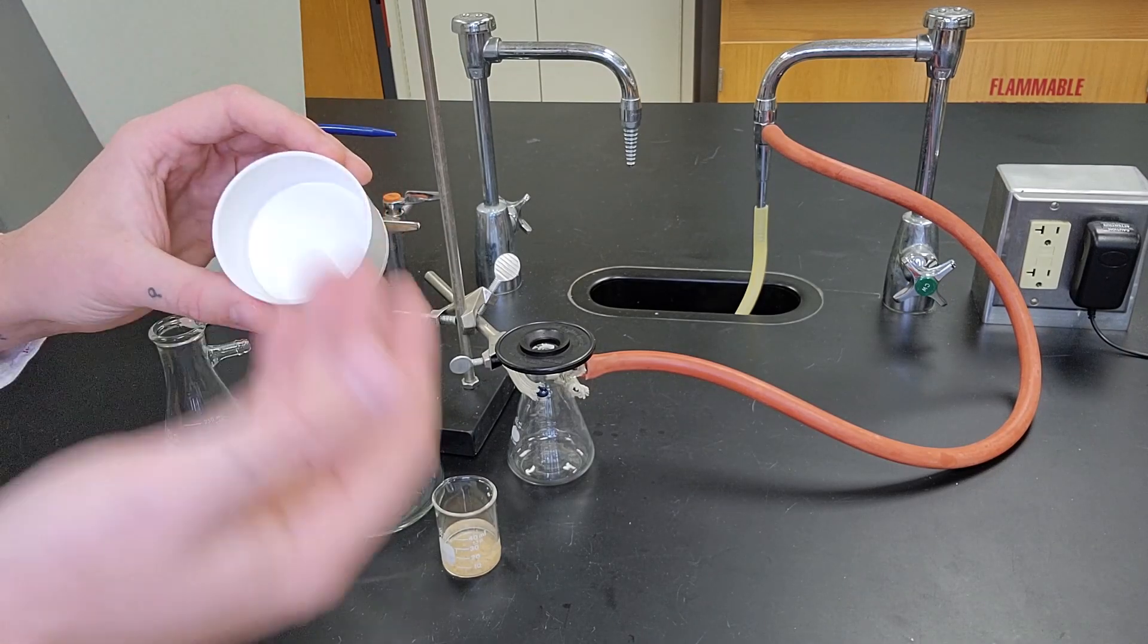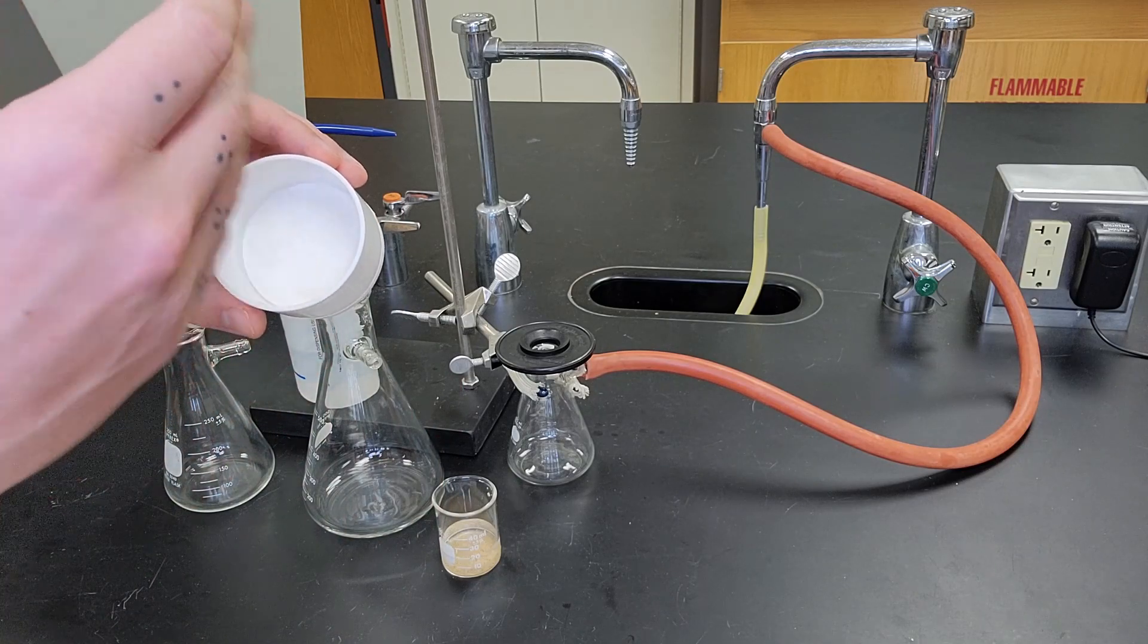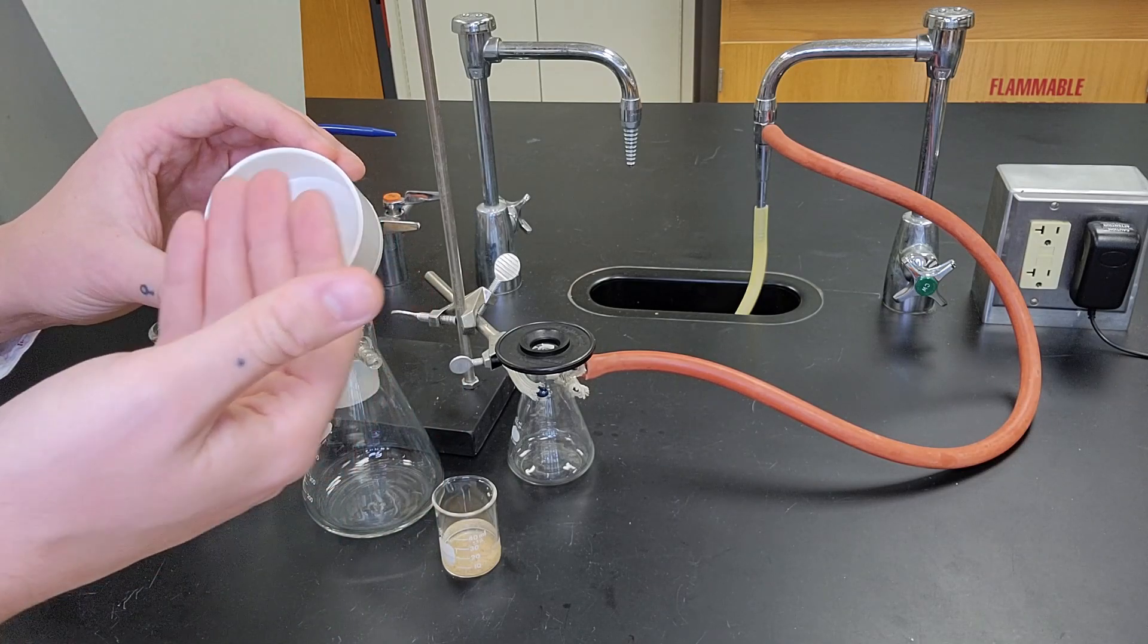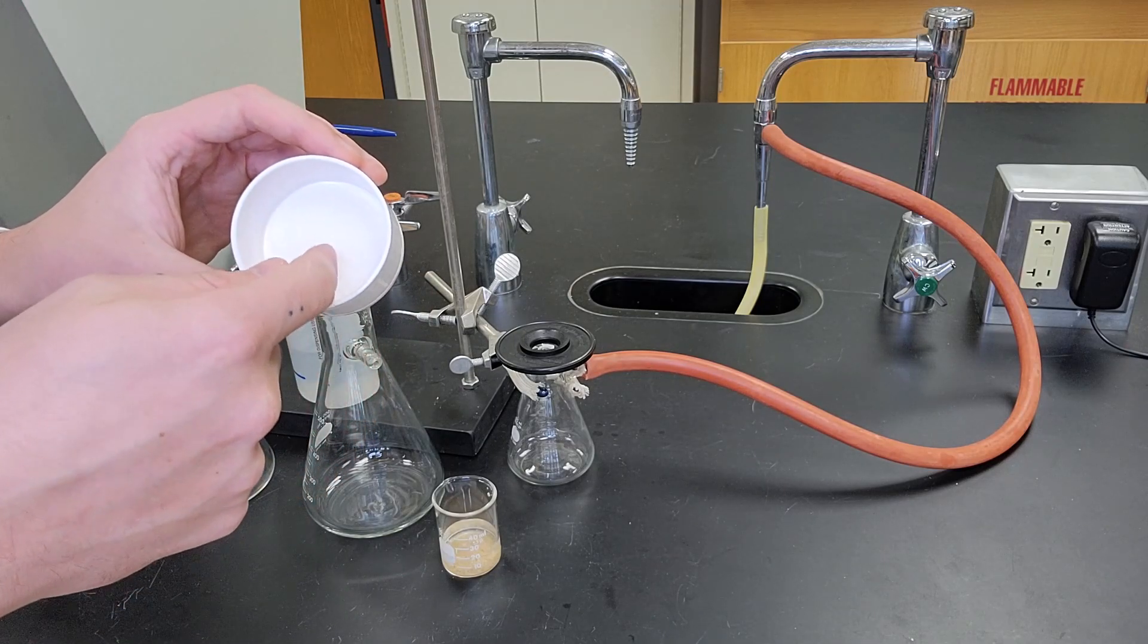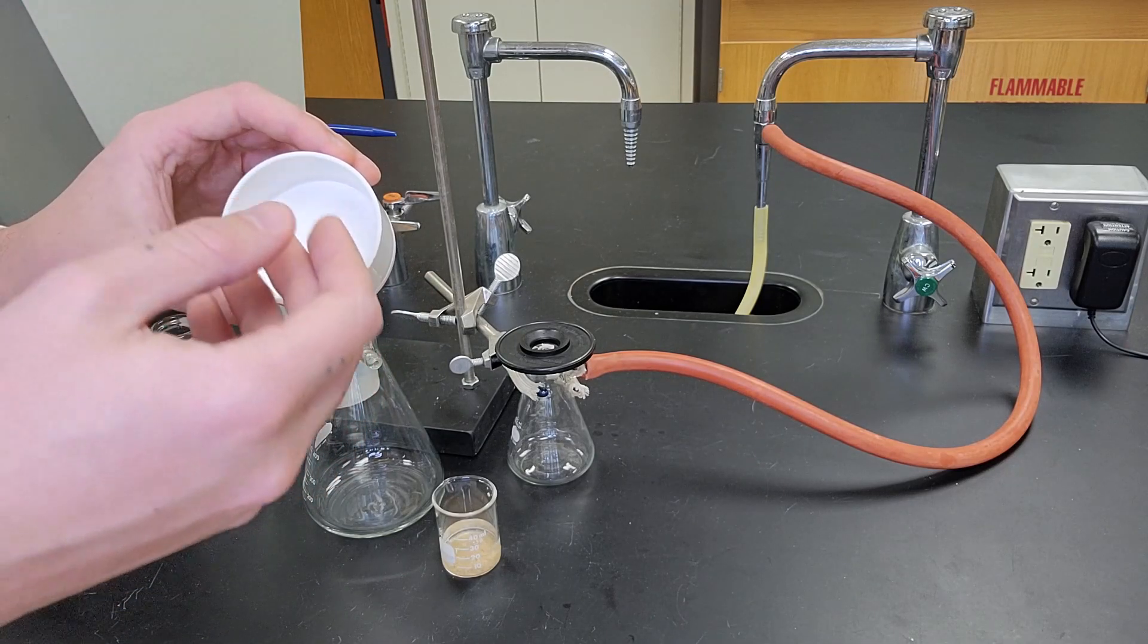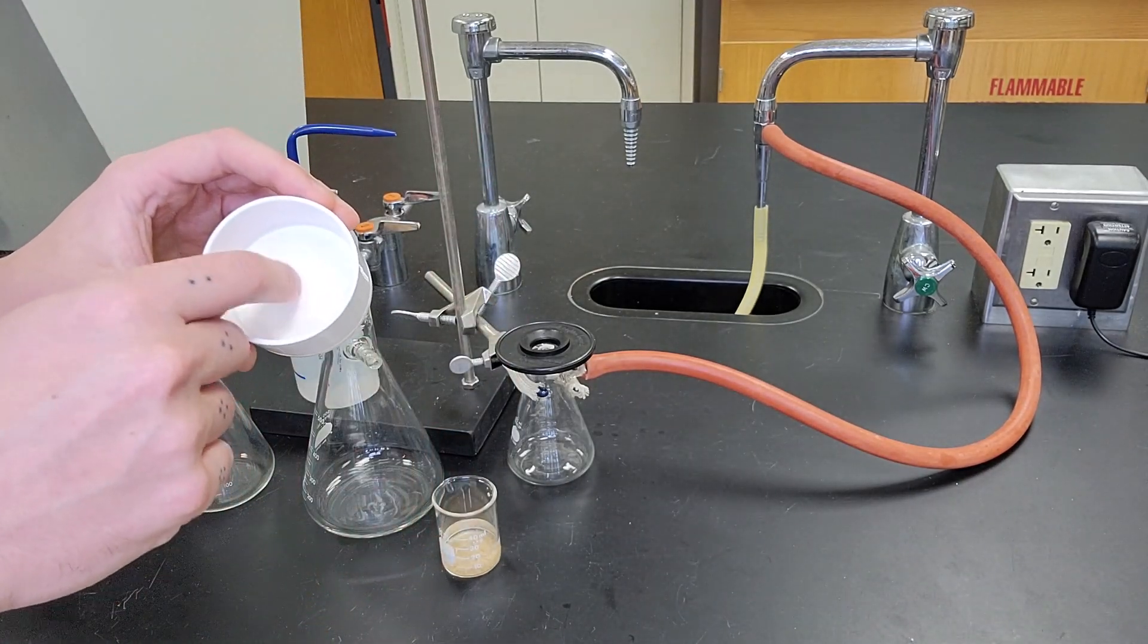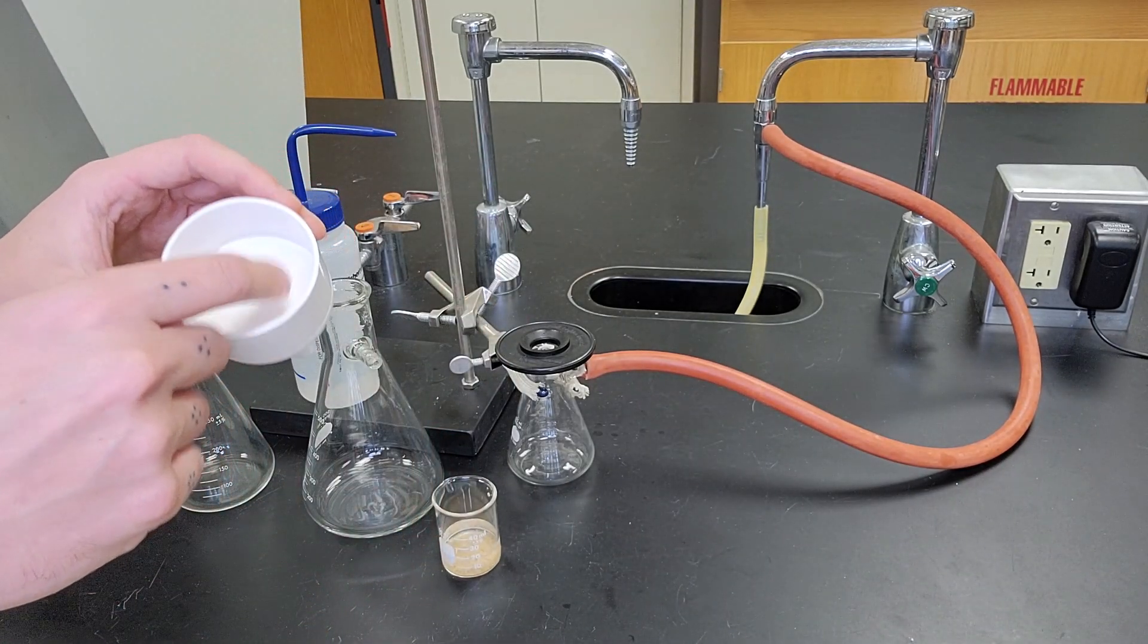If it is too large, it'll buckle up and won't lay flat against the bottom. If it's too small, it may leave some of those holes exposed and the solid can fall right through. So it's very important to make sure you're choosing the correct size filter paper.